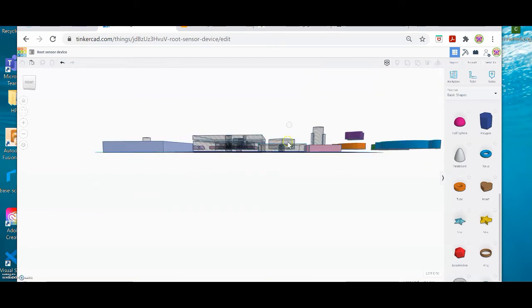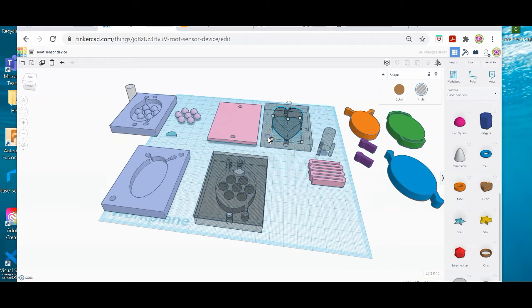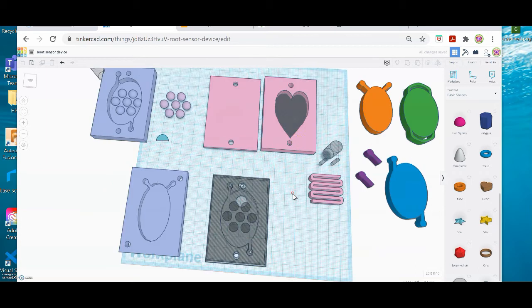I might push it down just a little bit more. Okay, and I'm going to orbit back this way. I'm going to turn my base plate pink again. And now to make this hole an actual hole, actually I'm going to widen it just a tad as well.